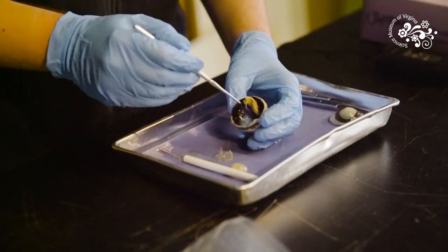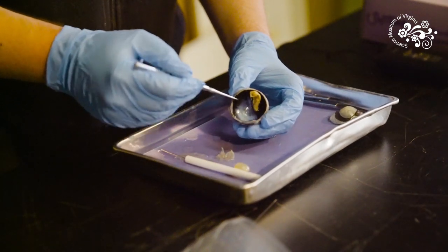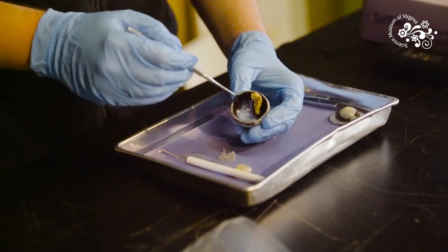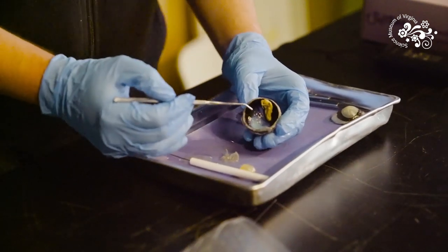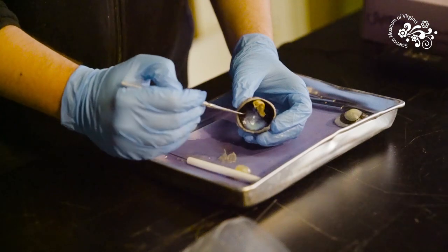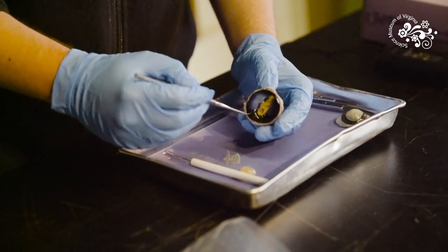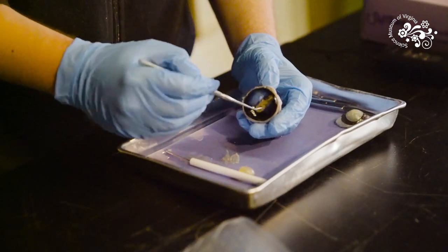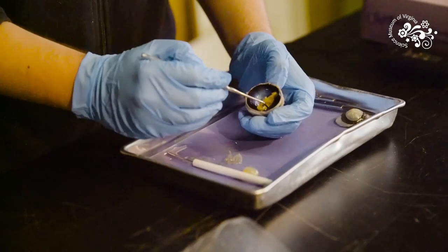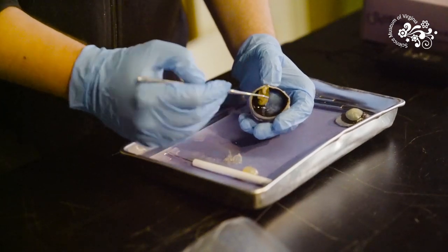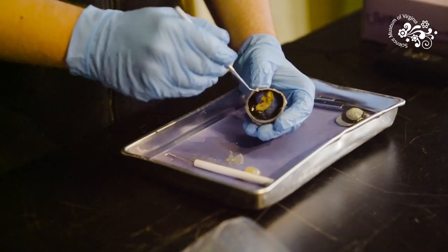In the back of the cow eye we can see this really bright shiny layer called tapetum. Tapetum is something present in a lot of animals but not in us. If you ever shine a flashlight or take a picture of an animal's eyes they have those bright shining eyes that glow back at you. That's because the tapetum is a reflector. Light that hits it bounces back out through the eye and it gives them good night vision but it always comes at a cost. In the back of our eye we have this dark layer called choroid. Choroid absorbs extra light and gives you better daytime vision. Cows obviously have a little bit of both and we are highly specialized towards good daytime vision, relatively poor nighttime vision, and we have all choroid in the back of our eye.